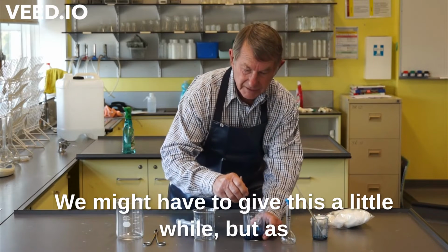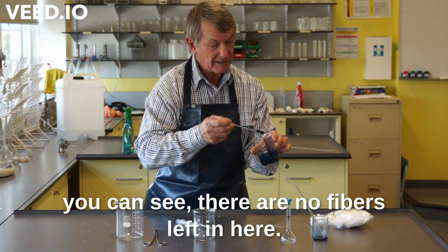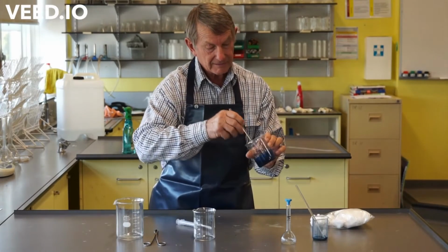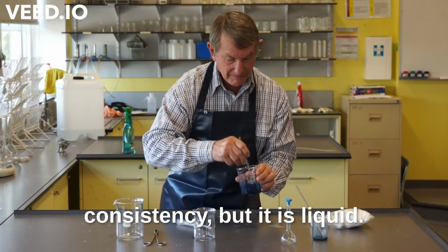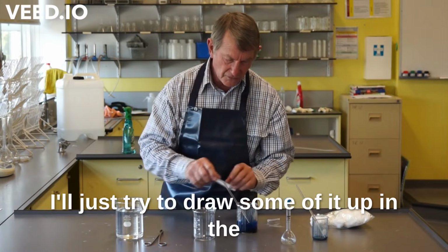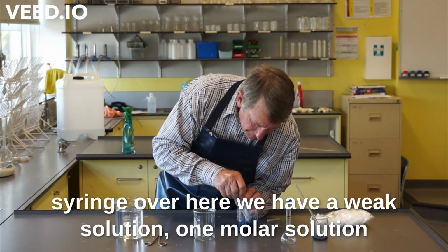We might have to give this a little while. But as you can see, there are no fibres left in here. We've got actually rather thick honey consistency. But it is viscous liquid. I'll just try to draw some of it up in the syringe. Let's see how we go.